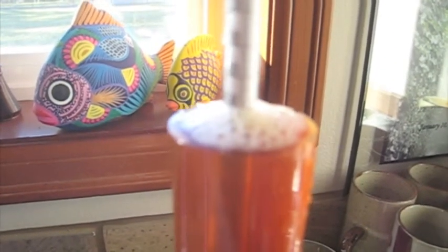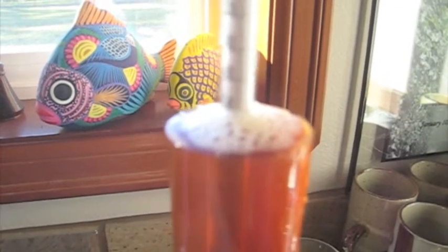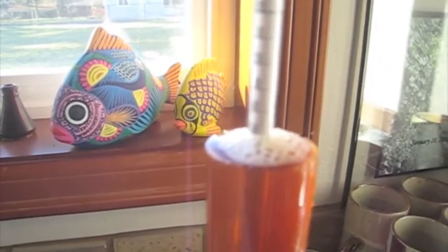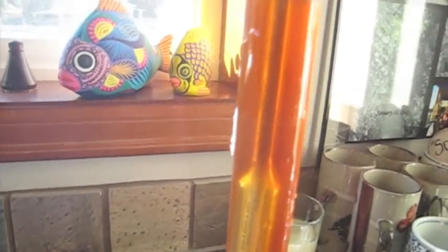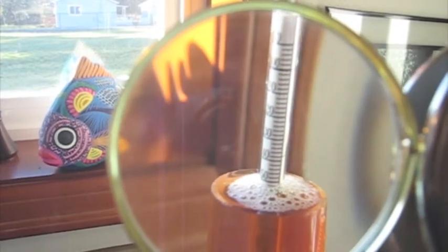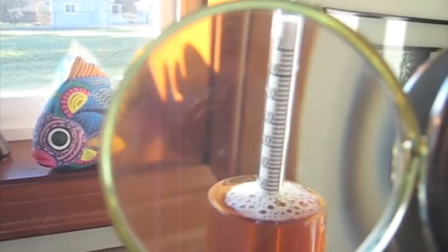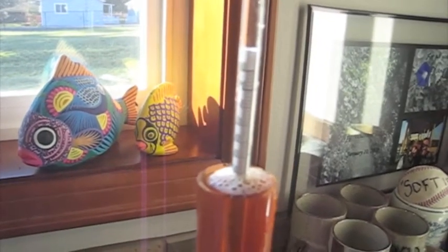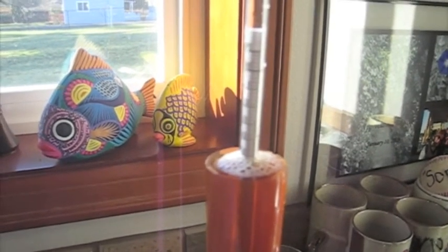And here is our post-boil. Let's see if I can get this in front here. And I'm going to call that 1054. Alright, I'm going to record these and then we'll see how things shook out.